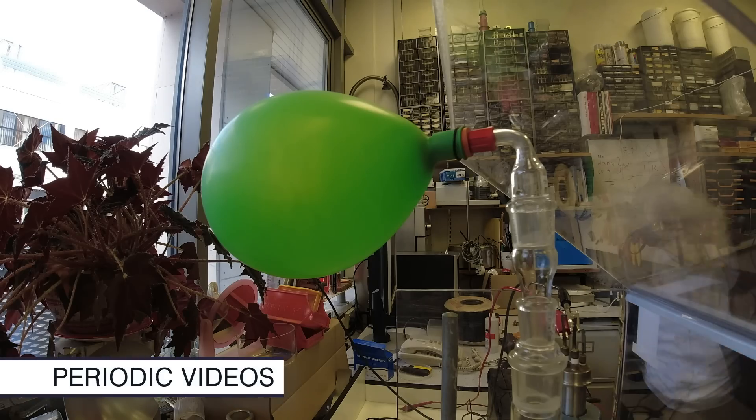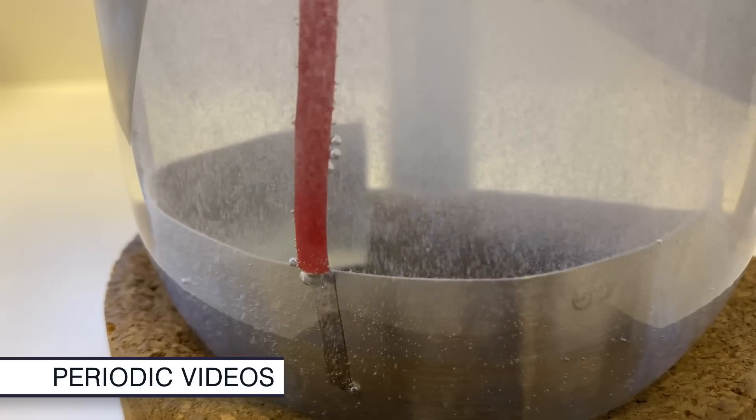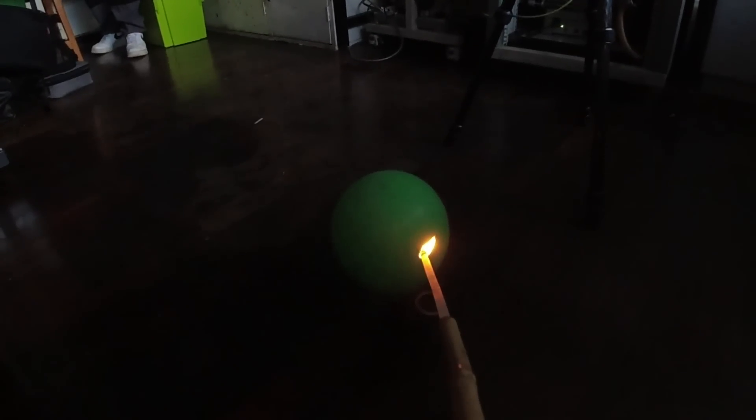Neil has created a new demonstration to illustrate an explosion of green hydrogen. Brady didn't know that there were even colors of hydrogen.